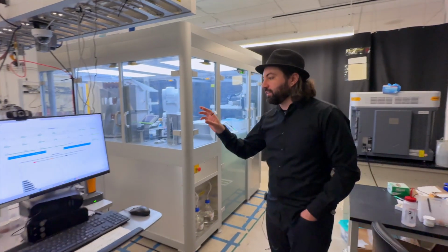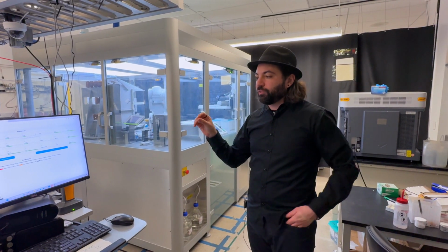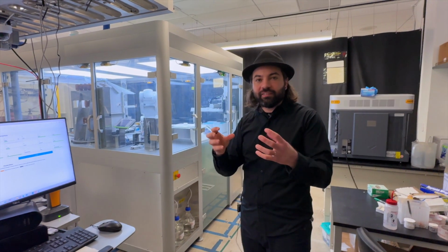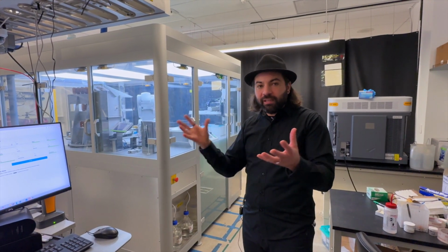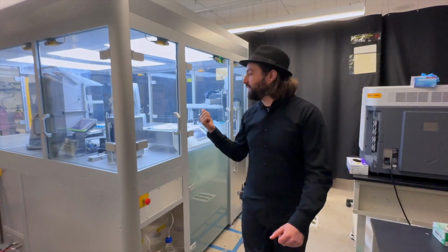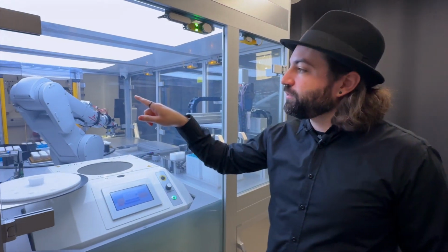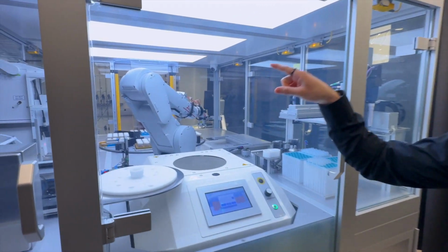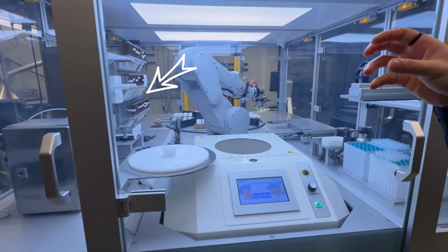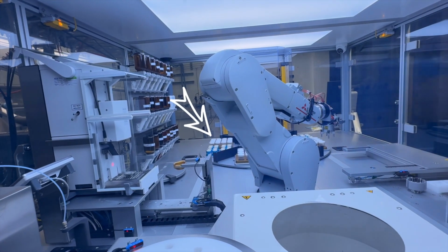Then once the computer receives your experiment, it's going to do the stoichiometry reaction and see for the recipe how much you need of each material. Then we go to the powder dosing station, where this robot arm takes from the bottles there, and from each bottle puts in the balance, doses everything inside one of the plastic containers that are in the background.